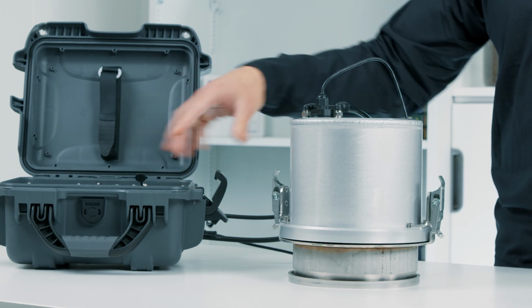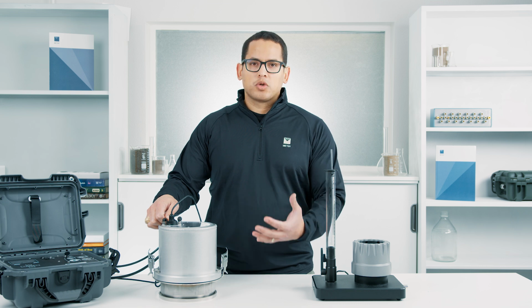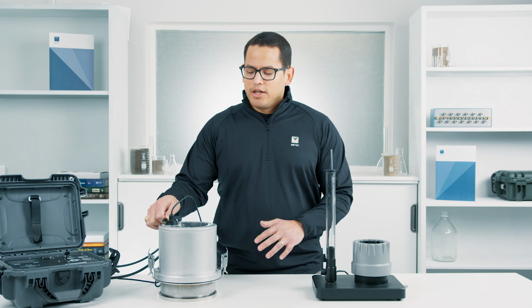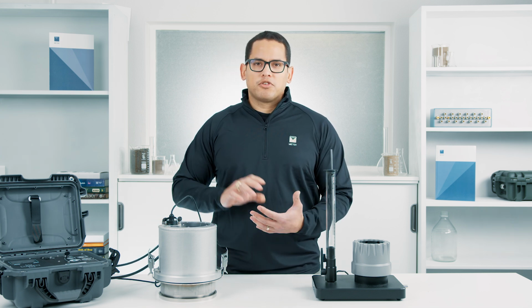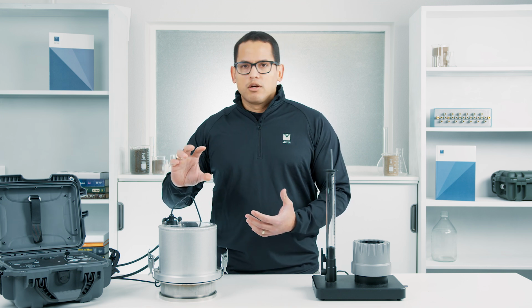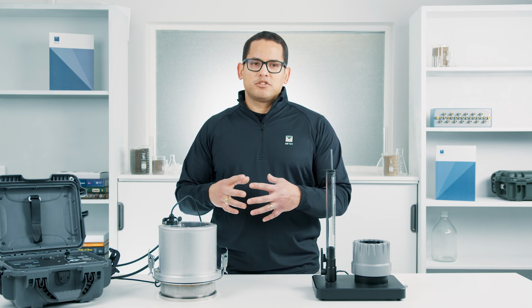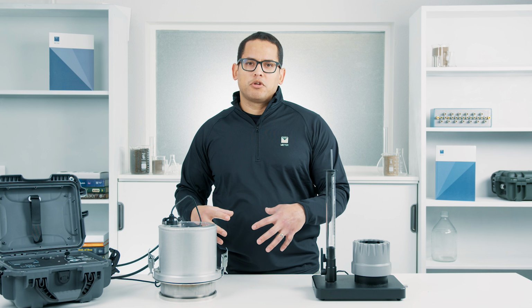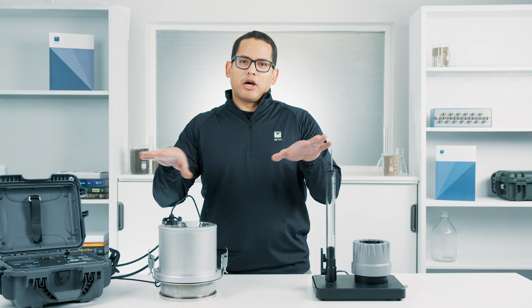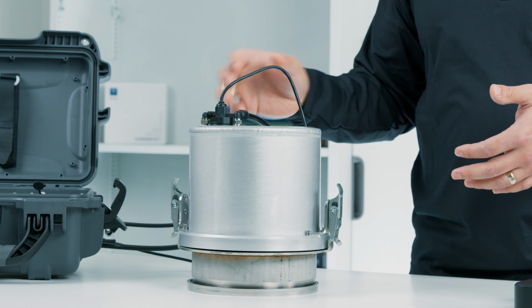And this device is pumping water into the chamber through this hose here. Then we're actually using an air line to control the hydrostatic pressure above the water column in the SATURO. And what that allows us to do is actually infiltrate water at two different hydrostatic pressure heads. And in doing that, we are actually able to calculate the sorptivity of the soil, and that allows us to simplify the approach of how we're correcting for three-dimensional flow from this device. So when water's infiltrating through this, it's not just going down vertically, it's also going out laterally. And so we have to make that correction. But with that dual head approach, that simplifies how we make that correction.